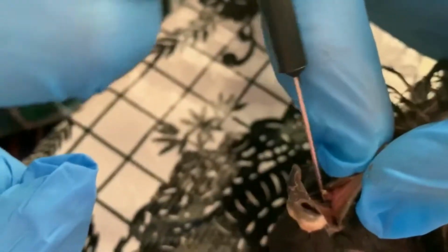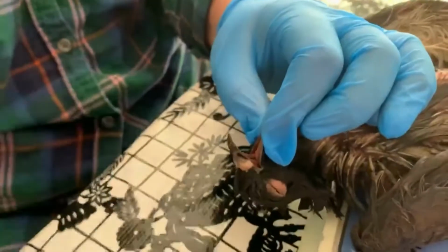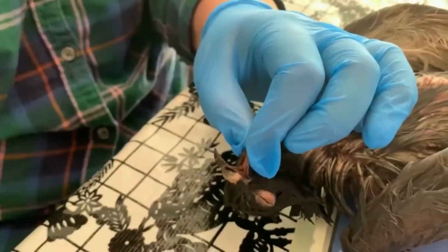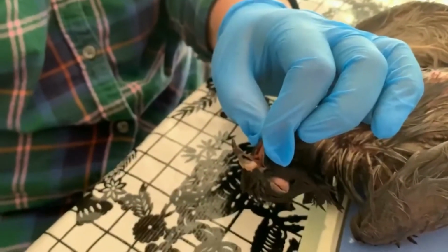And it's a slit-like opening on a raised area just posterior to the tongue. It's really hard to get in so close. And then if we were to poke further back, we would also have the esophagus. So just like we have adaptations in our throats that allow for us to breathe and eat through the same oral opening, so too do birds have similar sorts of adaptations.